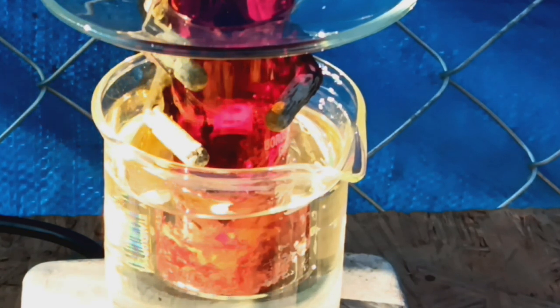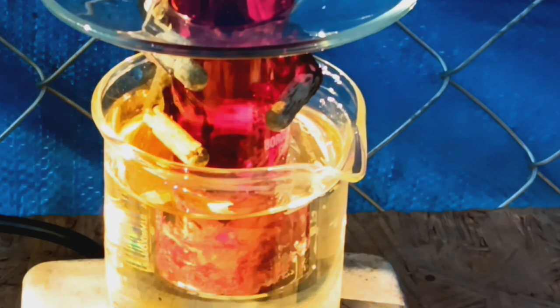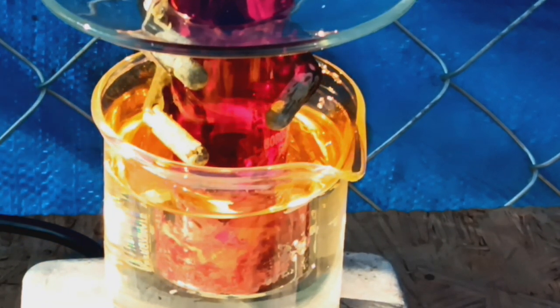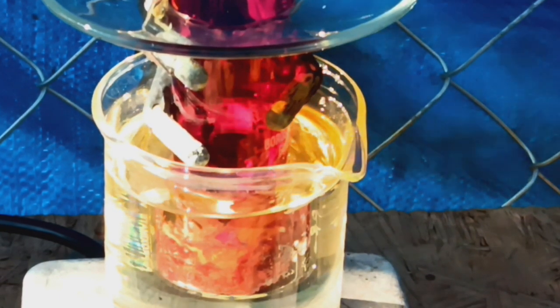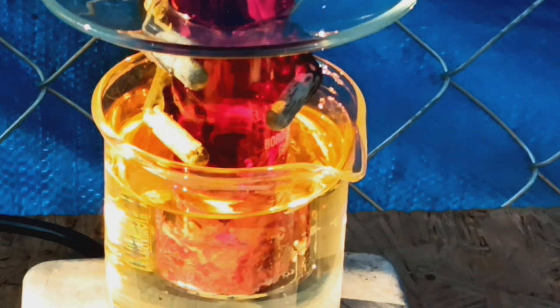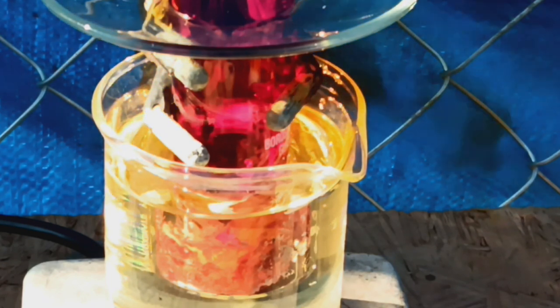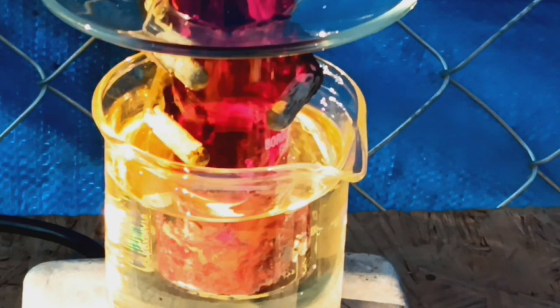It's a deep red gas that reeks of bromine vapor. There's stuff down there that almost looks like it's liquefying, even though it really shouldn't. It should sublimate, but it doesn't seem to be inclined to do so.